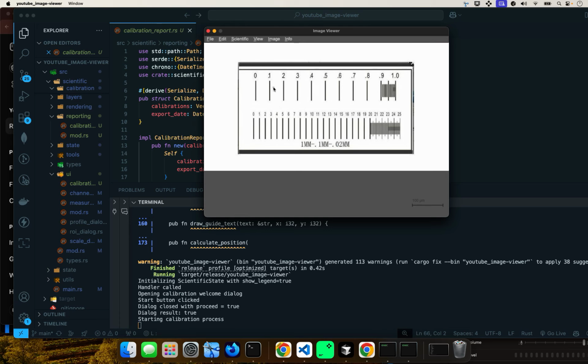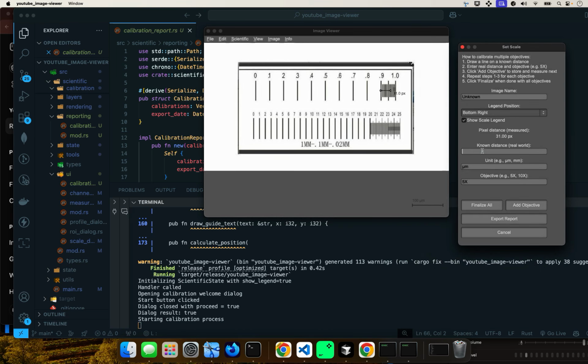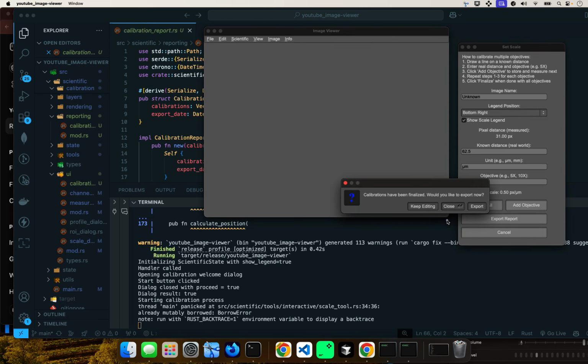This is why you have this small scale on the micrometer. Now we're assuming that this will be magnified to 100x. So now it will be 62 more or less. That's 50 microns. So let's just do it there. Like I said, I don't have a zoom. Normally you would zoom in to be exact, but this is just a proof of concept. So that will be, let's call it, 62.5 microns, and this would be, let's call it, 100x objective. And now you're done. So you say finalize all.